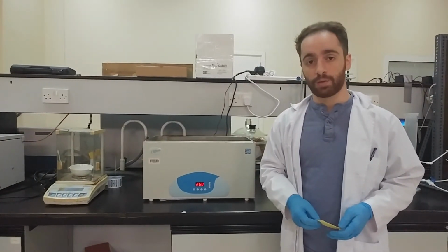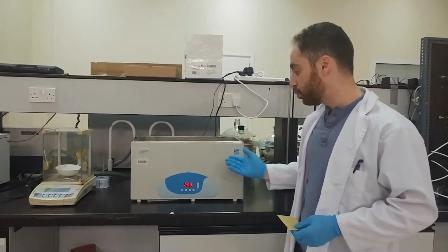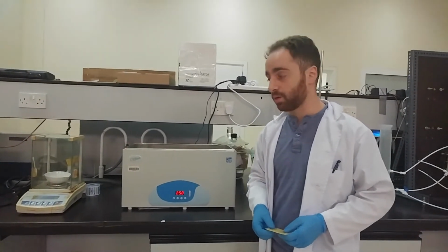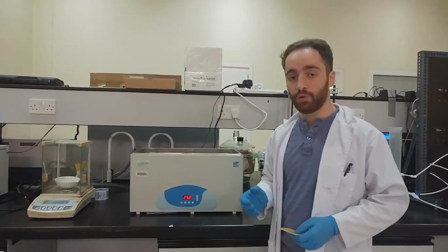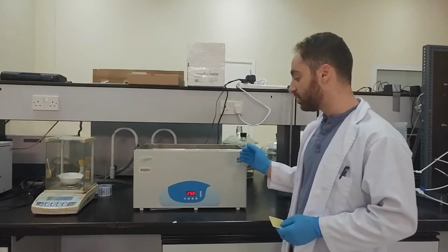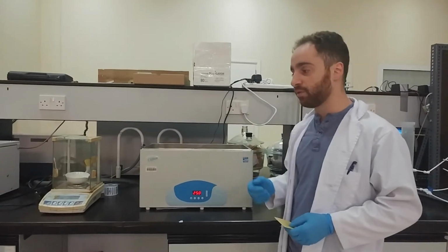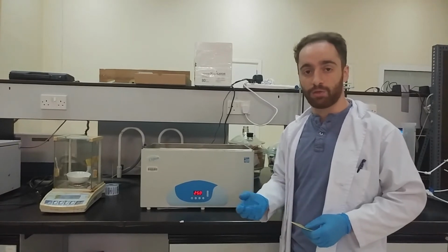The third part of the experiment involved the actual placement of the piece into the water bath. This water bath behind me is used for the lower temperatures, ranging from 25 to 40 degrees Celsius. At each temperature, we took multiple trials. Each trial removed a piece at a certain amount of time. For example, if we had 6 trials in a single temperature of known mass prior to the experiment, they would be withdrawn at certain time intervals, the first one being 3 minutes, the second 5 minutes, after that 8 minutes, and so on.